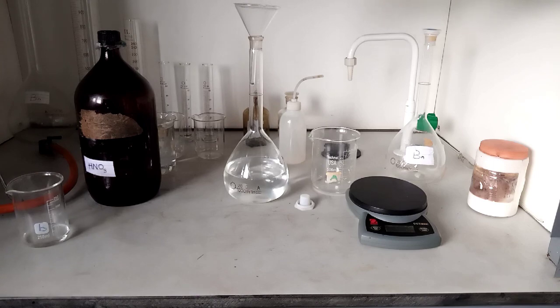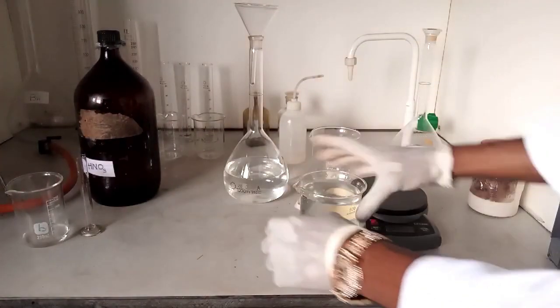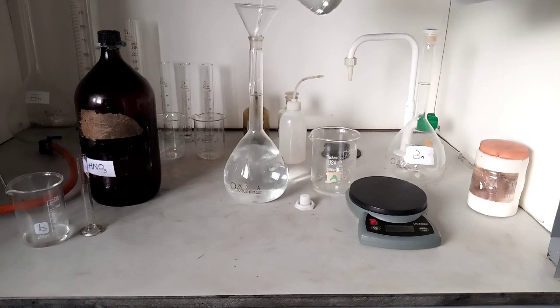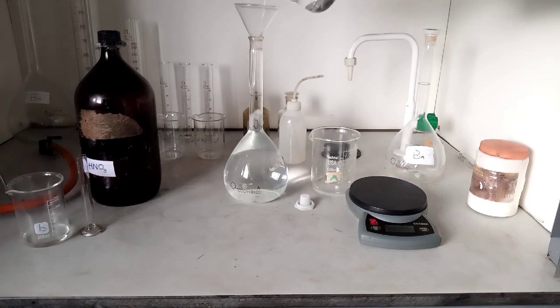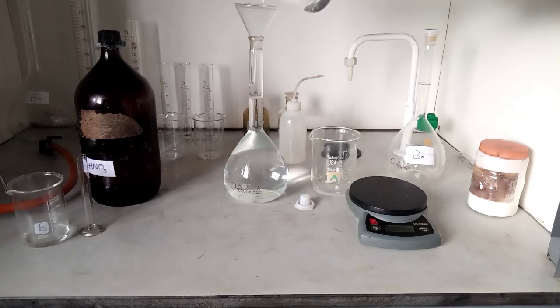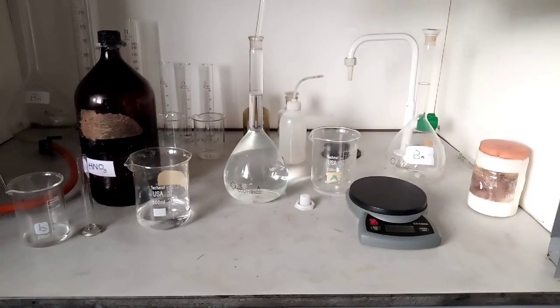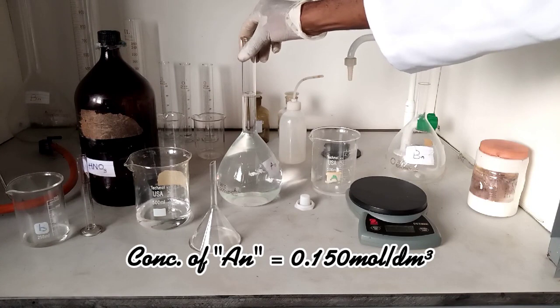Add the measured 9.50 cm³ of nitric acid to the water. Please ensure you put on your hand gloves because this acid is very concentrated. After that, dilute to the 1000 mark. When you are close to the mark, take it slowly so that it doesn't go above. Remove your funnel and take your reading at the meniscus. This is our AN and the concentration is 0.150 mol/dm³.